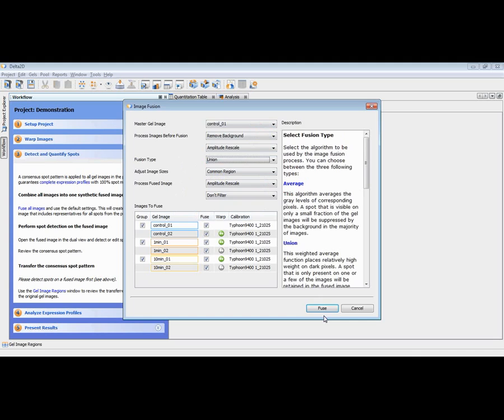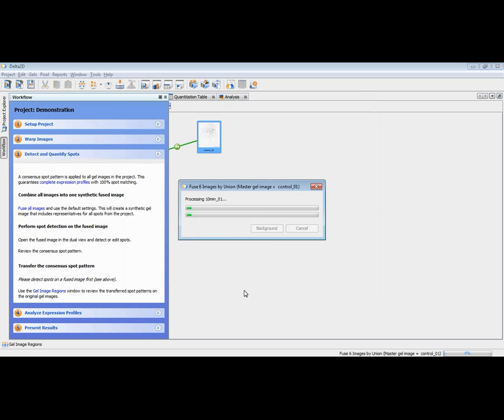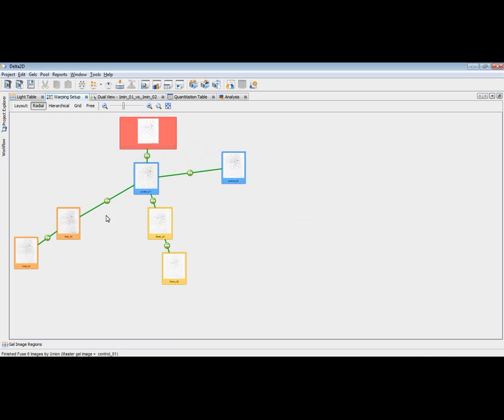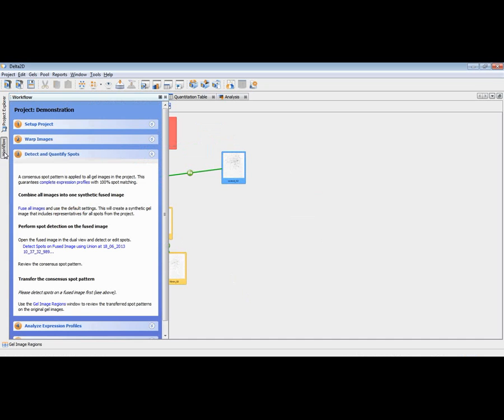and then fused to a fused image. I now press fuse, and then Delta2D is analyzing all my 6 images, warping them to the control 1, and then joining all these images, adding a fused image to my panel, to my warp graph. It's now attached to my control 1 with a certain warp relation. And we can now open it either by double-clicking this image, or in the workflow it's available to directly detect the spots on this fused image.